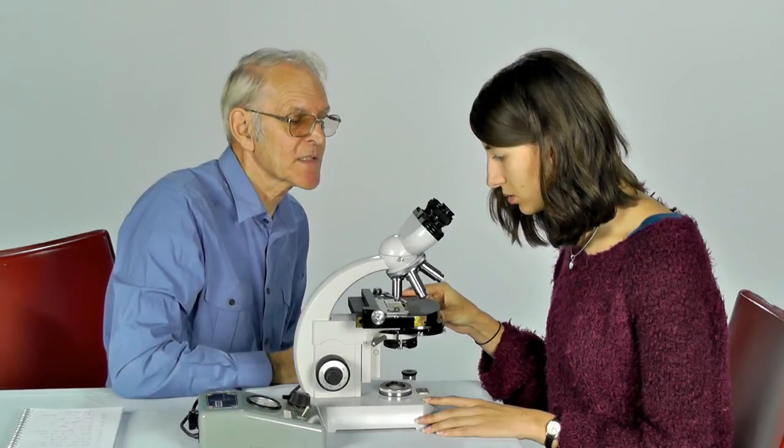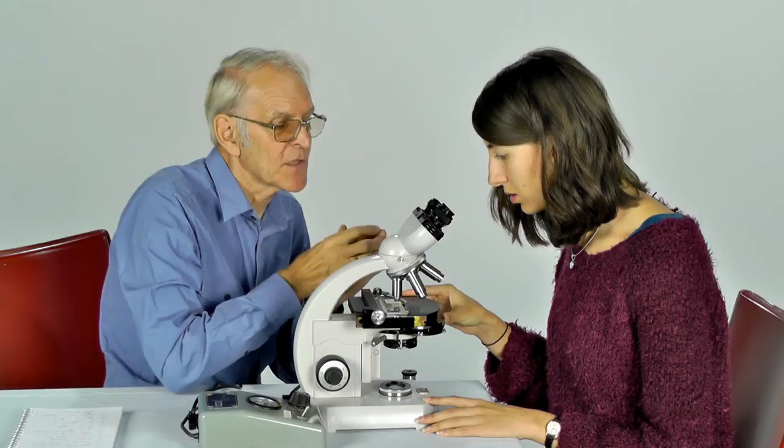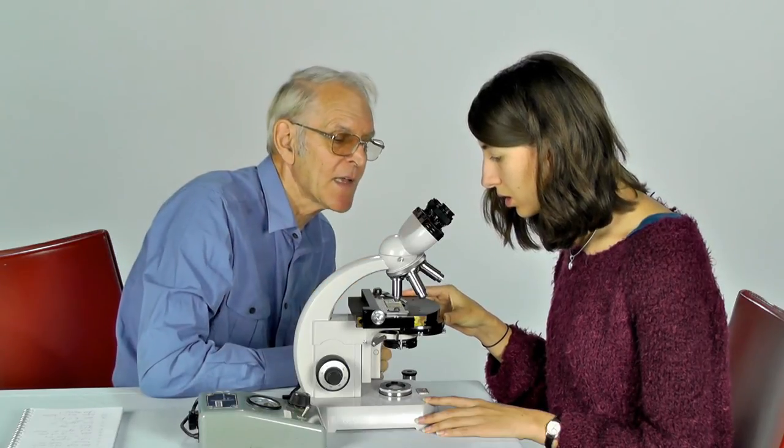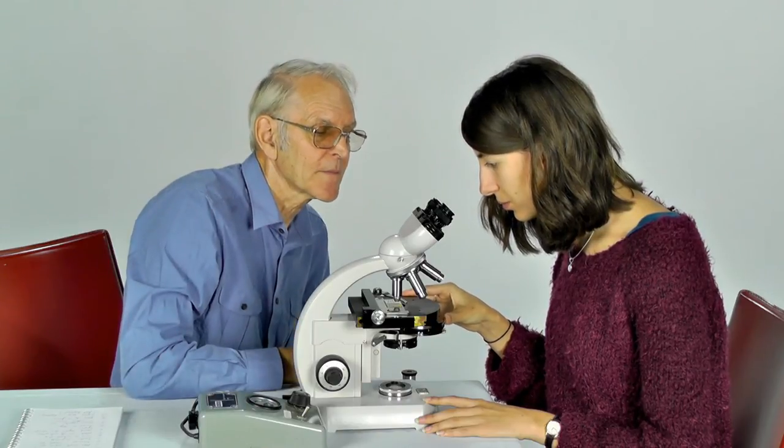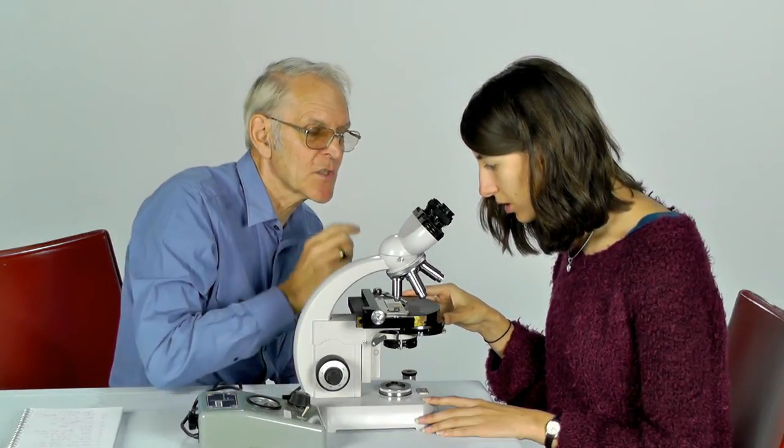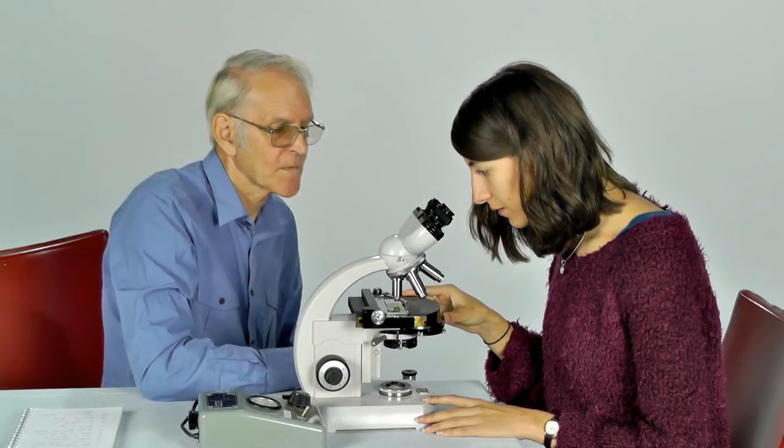And you're looking from a distance and you're going to try to arrange things so that you can just see the edge of that diaphragm. Oh yes, it's come in from the edge. And it should just be visible around the edge. Yep. I've got that. Good.